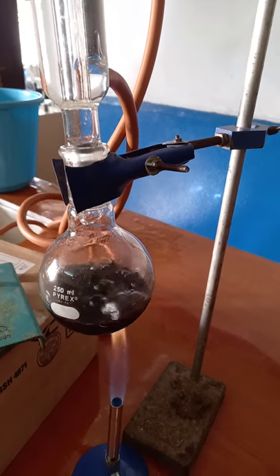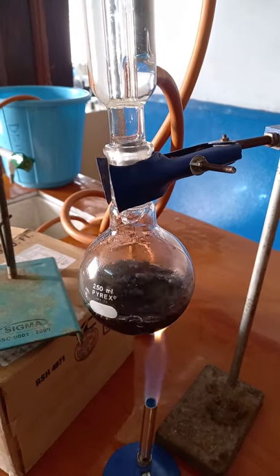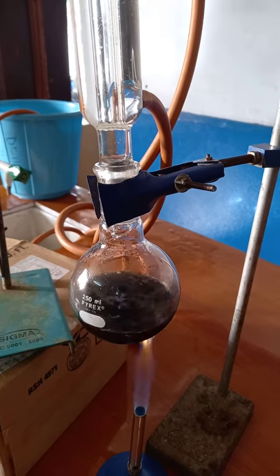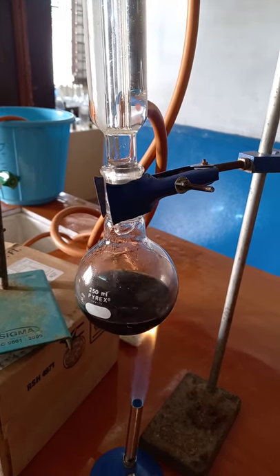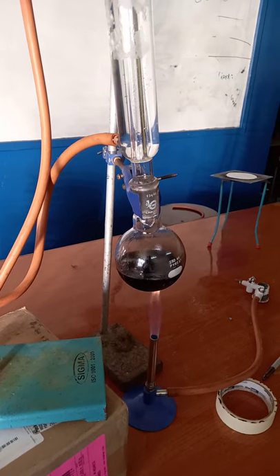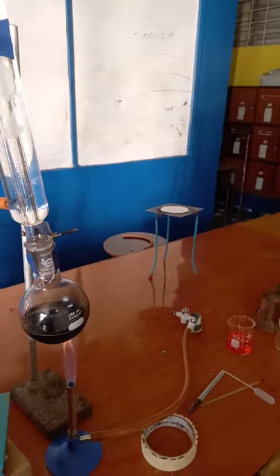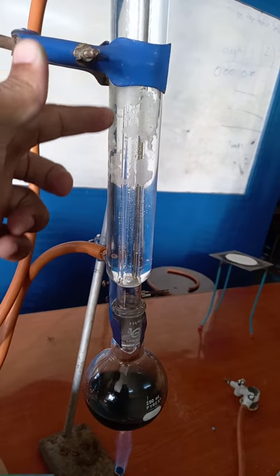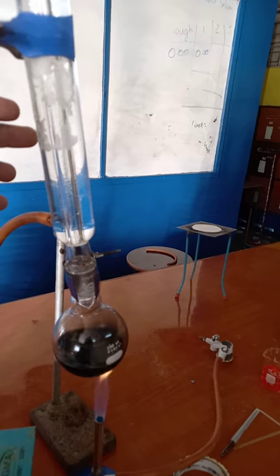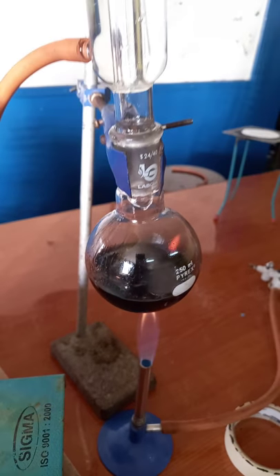Now you can see that the liquid is falling back into the round bottom flask. It vaporizes but it cannot escape and so it is condensing back. The fumes go up into the condenser, the cold water allows the vapor to condense, and as you can see it is falling back into the reaction mixture.